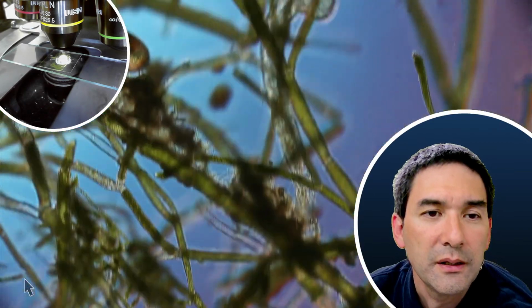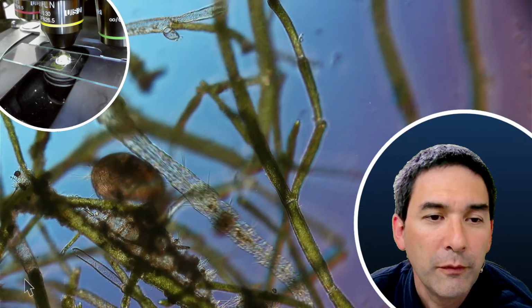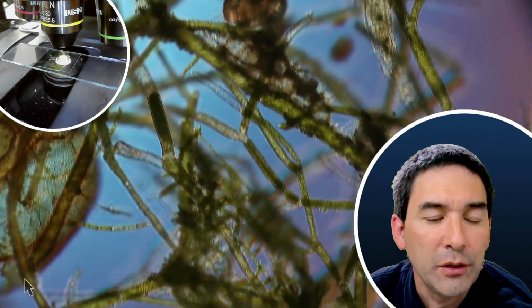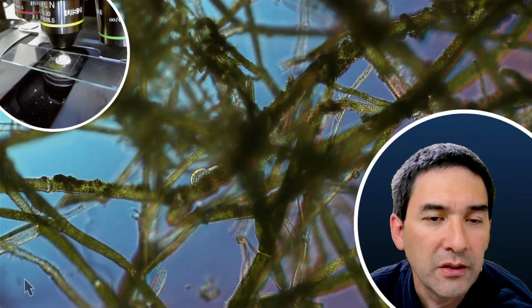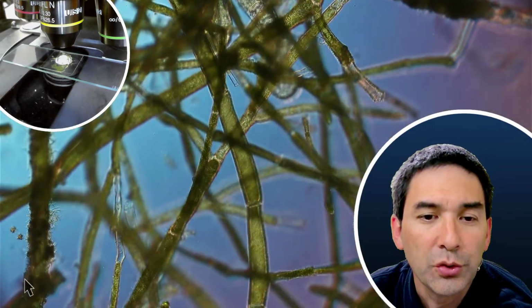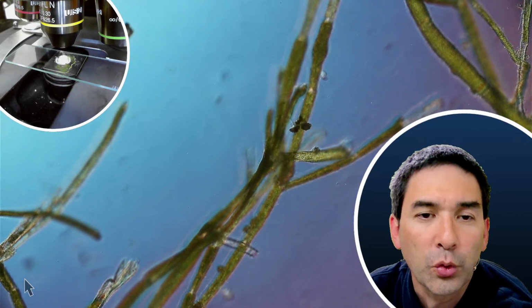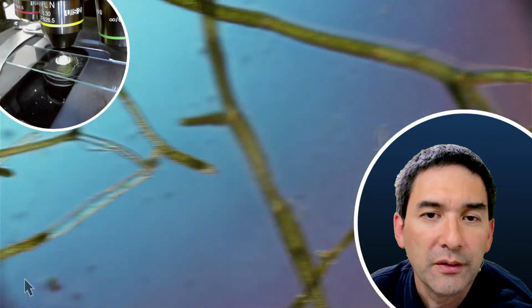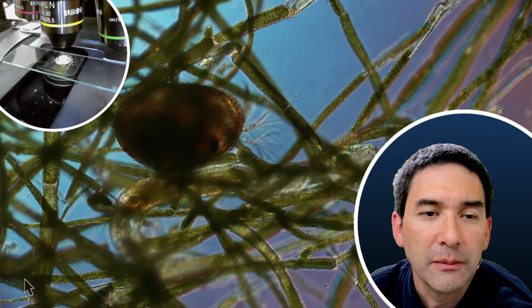By looking at the type of organisms that you're able to find in a water sample, you can do an estimate of water quality. Certain organisms only like to live in certain water qualities, depending also on the oxygen concentration present, and some people are able to do a water quality assessment by observing the organisms that you find. Yeah, so let's leave this here a little bit.